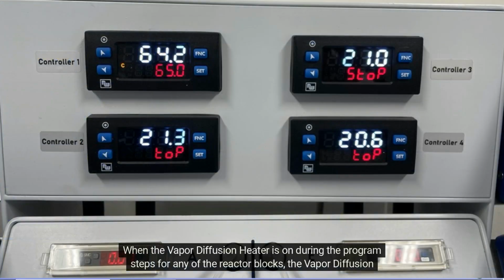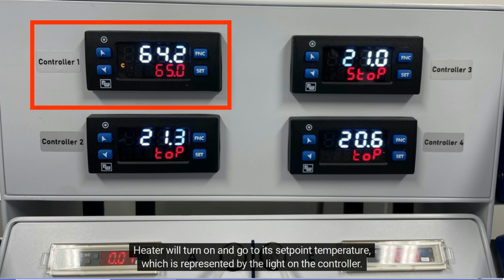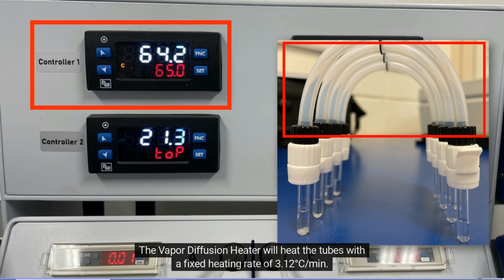When the vapor diffusion heater is on during the program steps for any of the reactor blocks, the vapor diffusion heater will turn on and go to its set point temperature, which is represented by the light on the controller. The vapor diffusion heater will heat the tubes with a fixed heating rate of 3.12 degrees Celsius per minute.